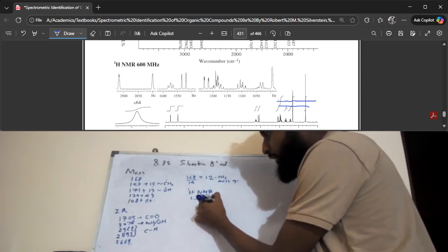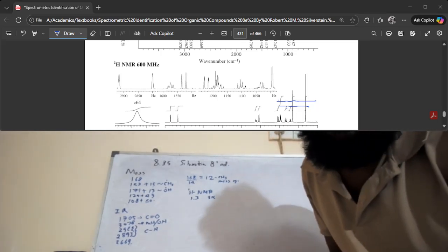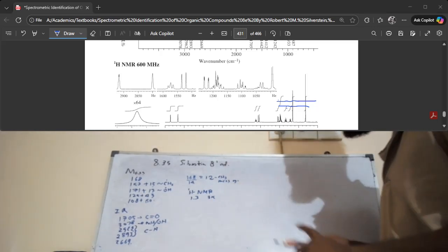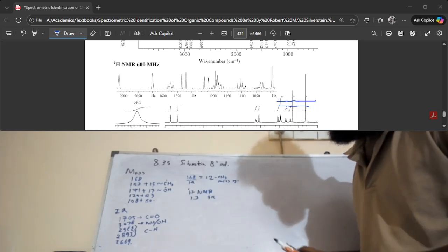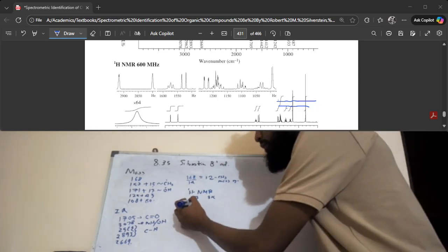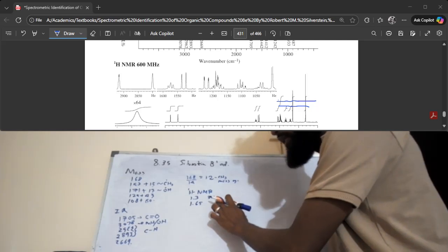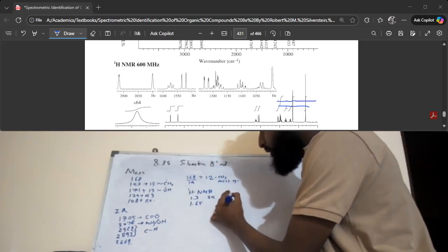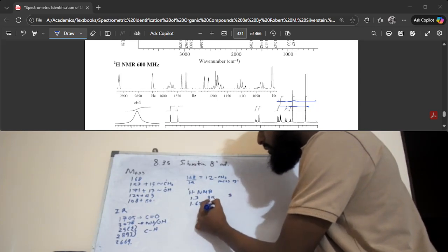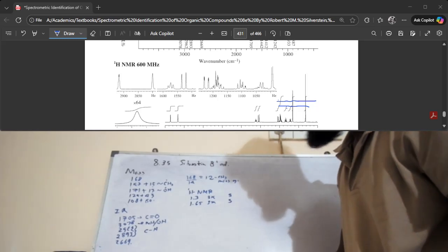3x protons, right? The reason why I say x is that x could be 1 or x could be 2. If you have a very perfectly symmetric molecule, x might be 2. We don't know that yet. We absolutely have no idea about the molecular structure. So we're just going to say 3x. We can conclude, and it's a singlet. So there, 3x singlet. That's 1.65.